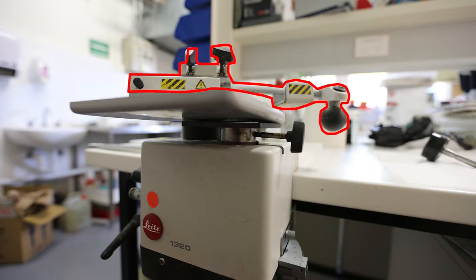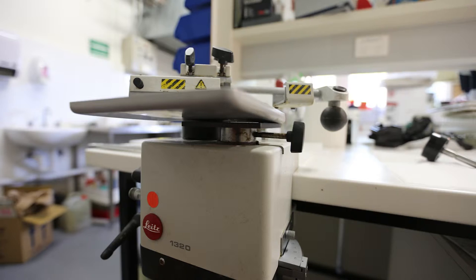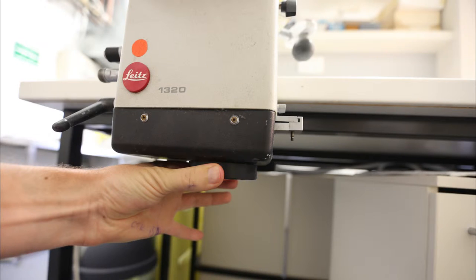But even if you use the blade arm or twist the adjustment wheel underneath the microtome, the stage won't advance or wind downwards, and I don't know why.